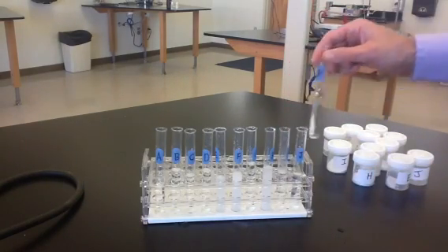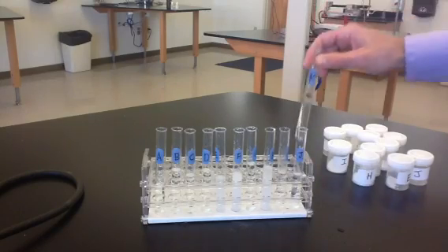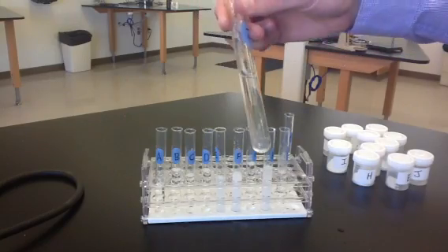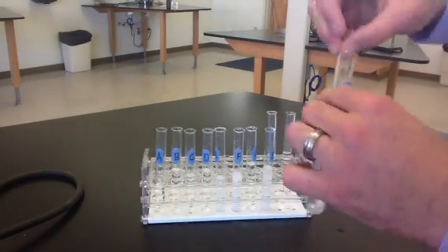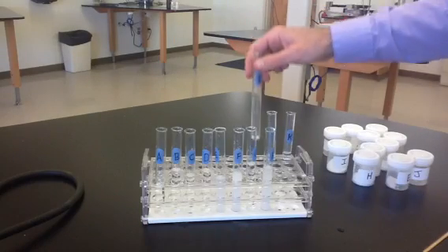So take a look at these. So clearly K is dissolving in water. I'm going to sort these out by which ones dissolve and which ones do not. J appears to be dissolving in water. I, if we stir it around a little bit, appears like it's starting to dissolve in water.